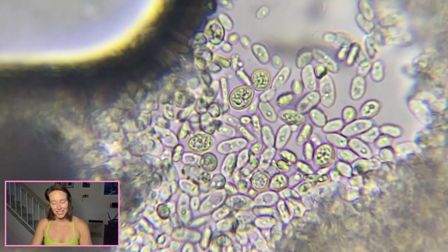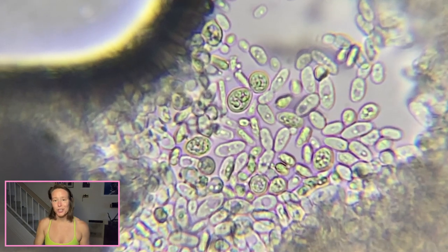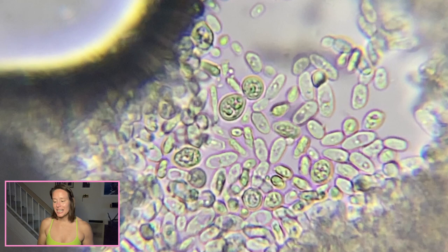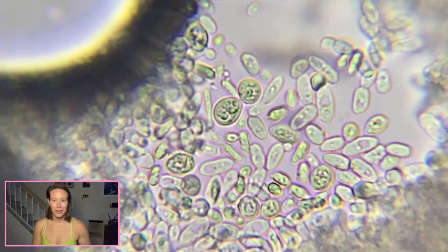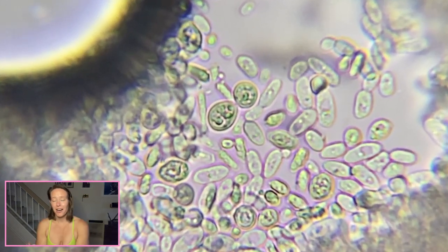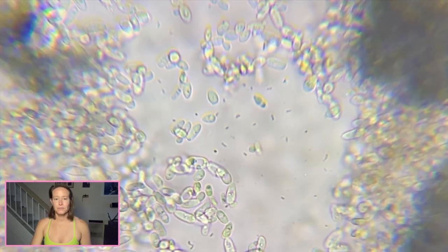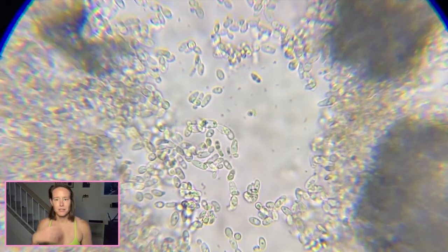Now, I also located some actual fission yeast that were larger that resembled the yeast that I saw when we looked at the pomegranate wine under the microscope. So here we have some large Schizosaccharomyces yeast. There are also some bacteria here, but this is predominantly yeast that we're seeing.